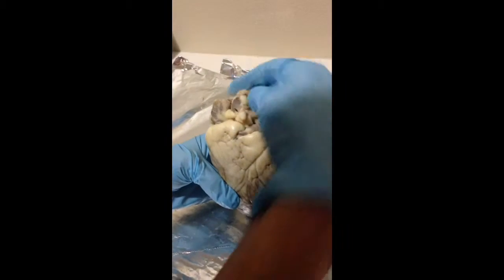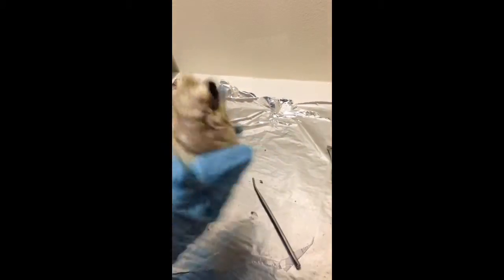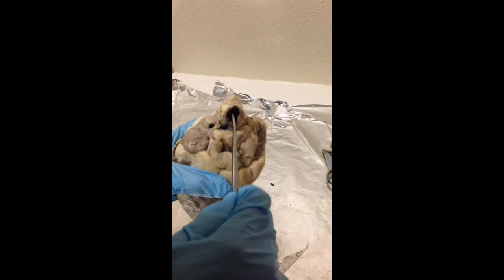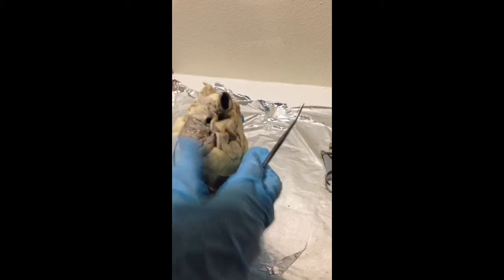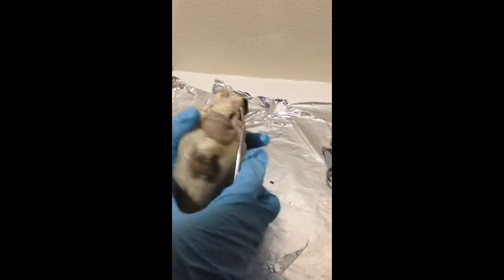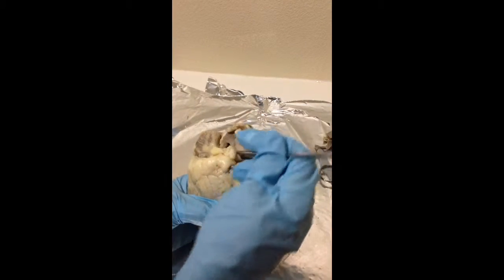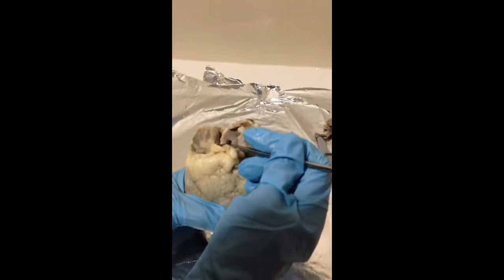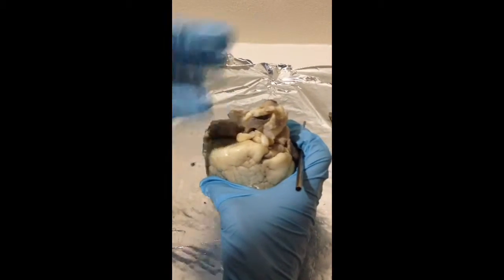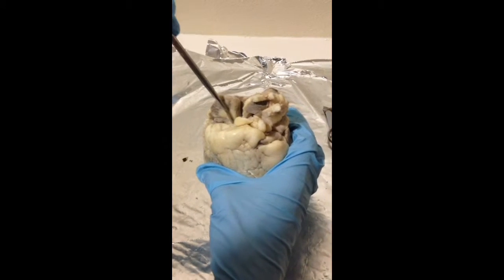The aorta is this arch here, this vessel here. Turn it around. This is the aorta, and basically the blood from here goes to the rest of the body to be distributed, and this blood is already oxygenated. The ascending aorta, although you won't be able to see much here, is in the front next to the superior vena cava in here, and goes out of the heart.